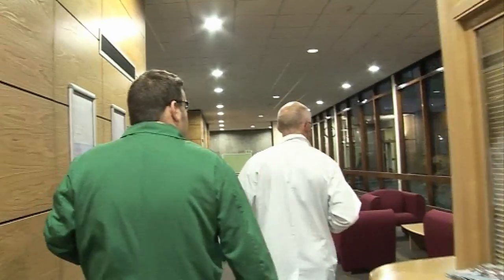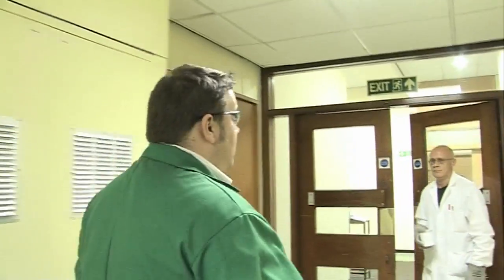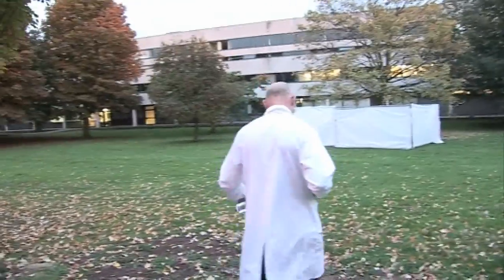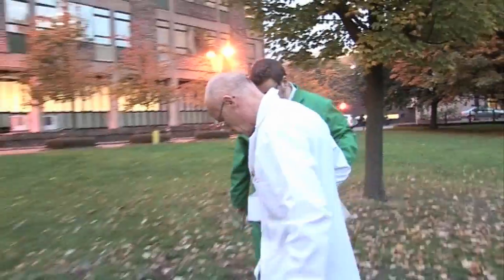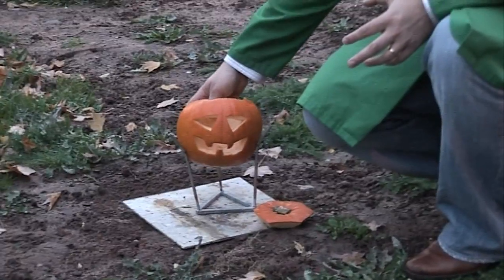Many people have said we're going to play with liquid oxygen, but Neil and I had a bit of a chinwag and we decided that was far too obvious. So we've gone for another one of our favourites, which Neil has got in his hand — a small charge of thermite. Thermite is a mixture of aluminium and iron oxide. It's a classical competition reaction where they're competing for the oxygen. Aluminium is going to win because it's much more reactive, and it's going to make molten hot iron, which we hope is going to total our pumpkin.